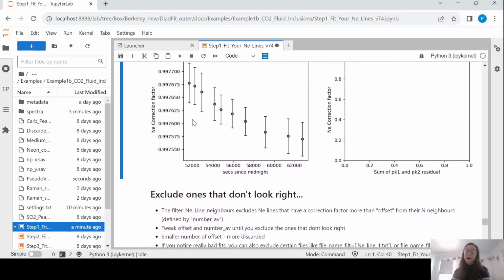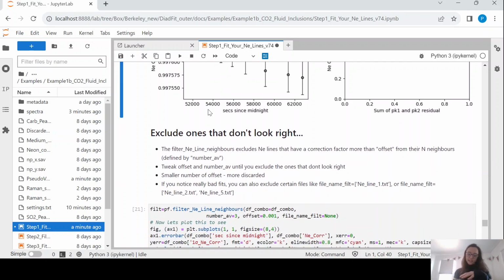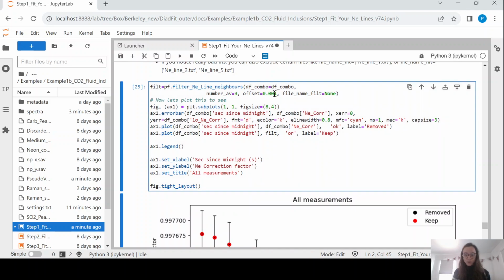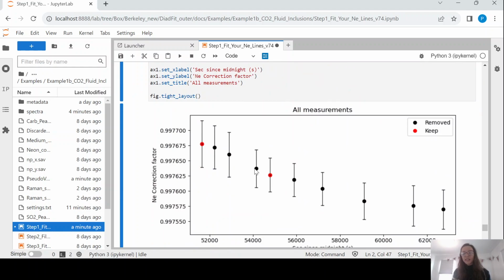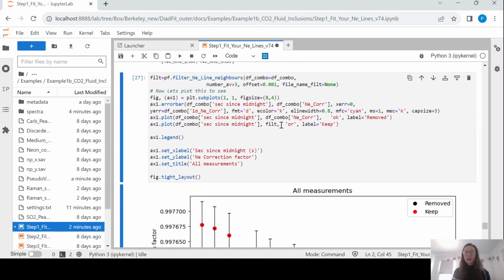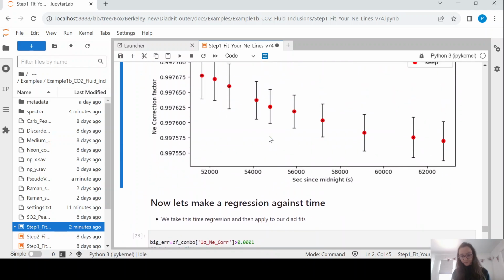Now you might have some outliers. Sometimes you get a funny peak fit, sometimes maybe you forgot to turn your laser off when you're acquiring neon and you have something on top and it just looks garbage. So with this function here, filter neon line neighbors, you can basically define an offset. So this offset here, 0.001, if we make this really small, you can see it has removed these neon lines, which are more than that distance from their neighbors. As we make this larger again, you can see we keep them. So you basically want to adjust this number until you get rid of the ones which look really rubbish.